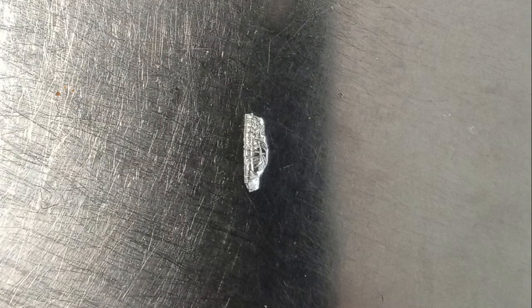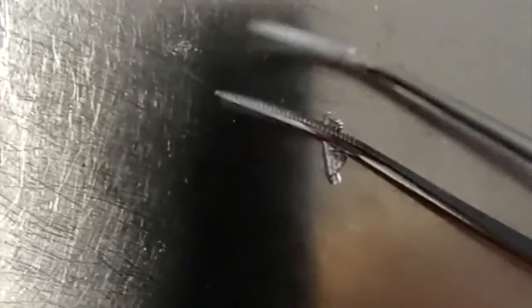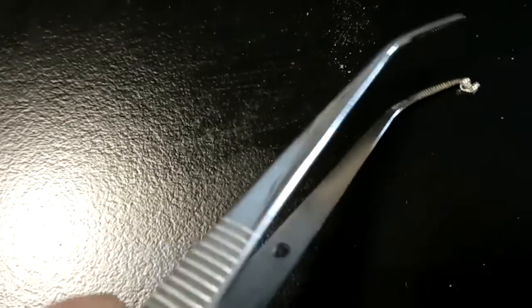After you've folded this three times, you can start to fold it down the other way, almost how a snail shell is coiled, making sure not to tear the tin cup and lose any of your sample. Then gently roll this round again, maybe three times, depending on the size of your tin cups.